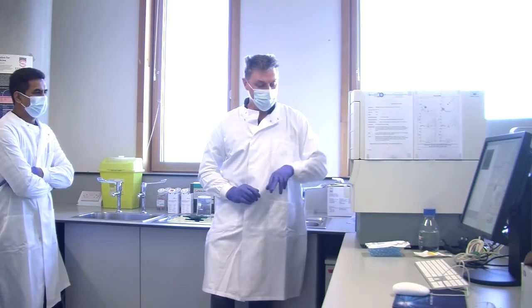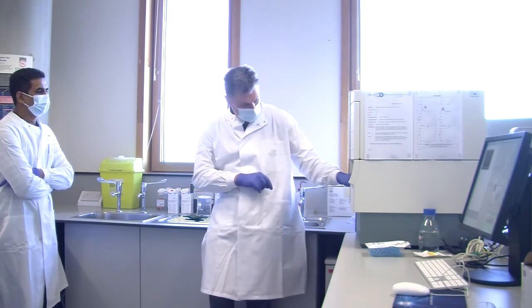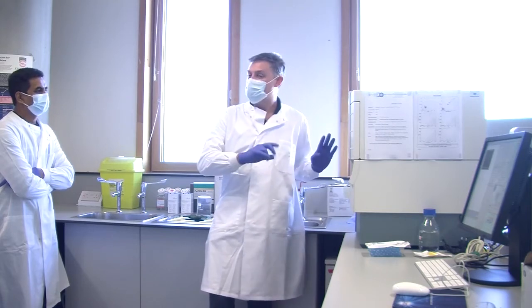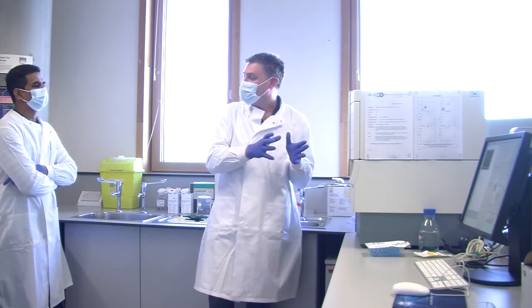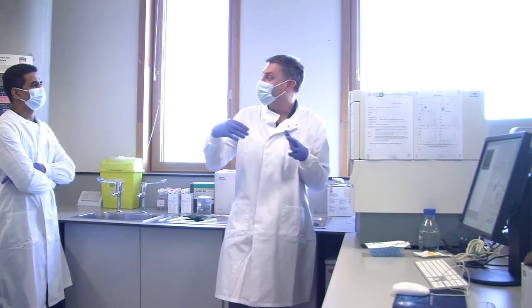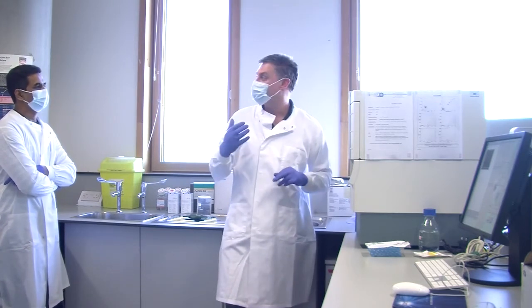We've got one button that means it's running. But while it's running, fluid is now running through. So fluid is running from here, which is just water. Fluid is running from here. But it's just running, and it's pointless leaving that on. Added to which, our laser is on as well. And lasers are like light bulbs. They have a lifespan. You don't know what it is, but when it reaches a certain number of hours, that laser will just pack up. So when you put it in standby, it switches the laser off.